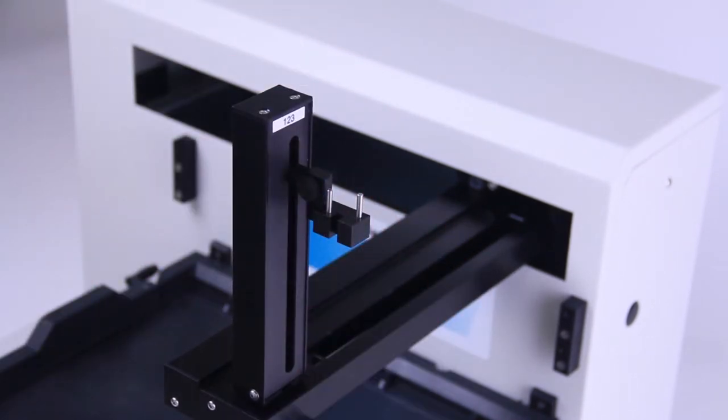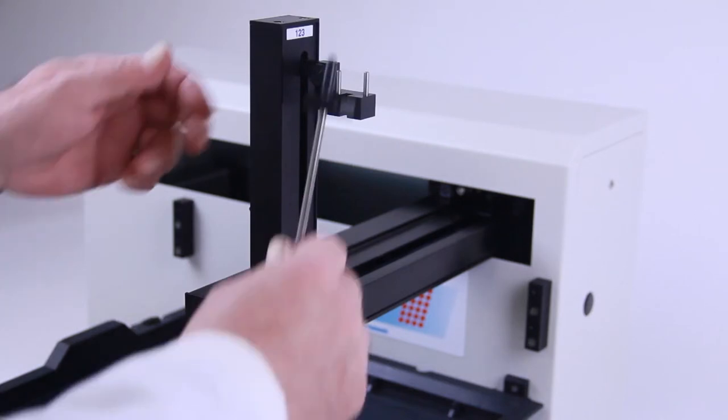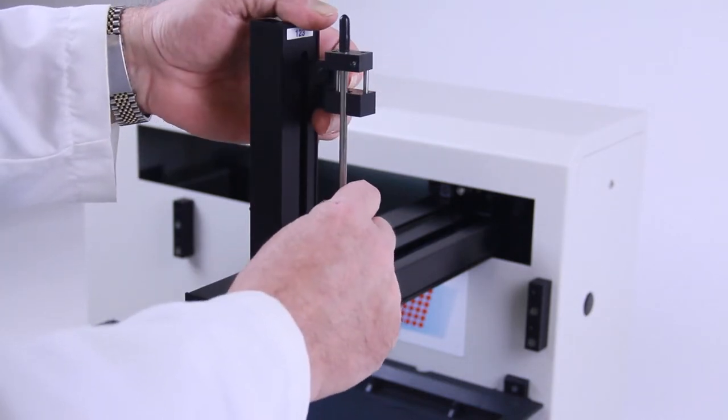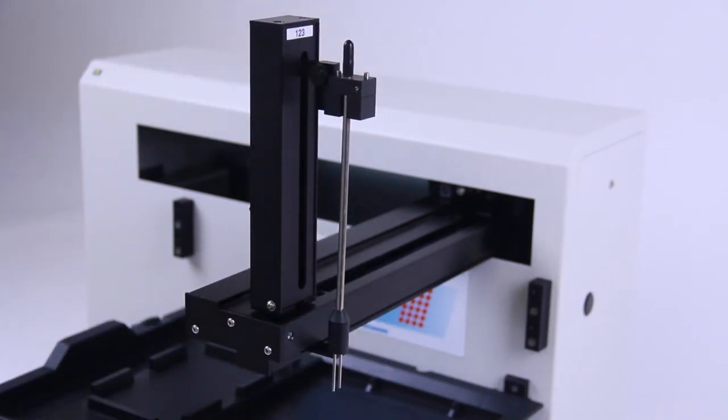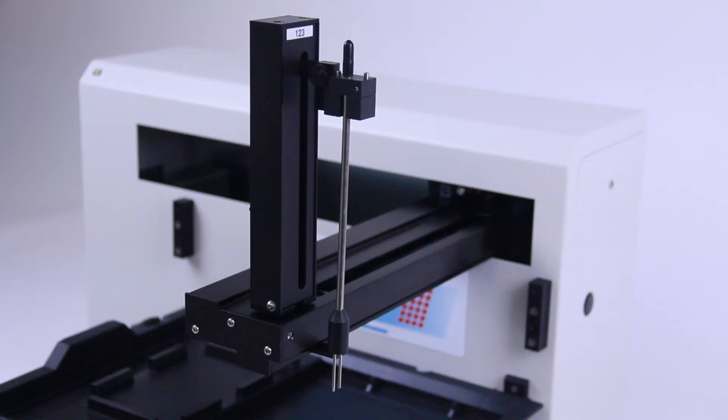To install the dummy electrode, slide it onto the two pegs on the electrode holder. The dummy is used when you're programming the movement of the arm and the sensor between the wells and the cleaning station to avoid accidental damage to the real electrode.